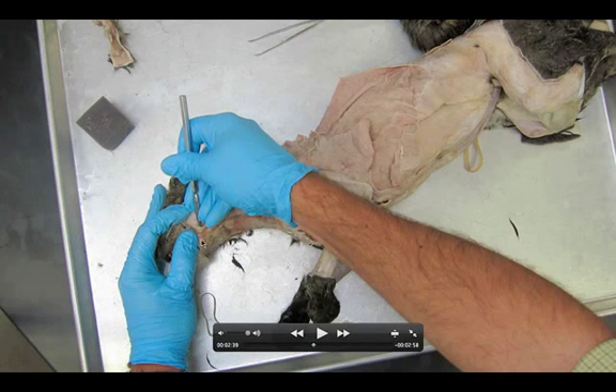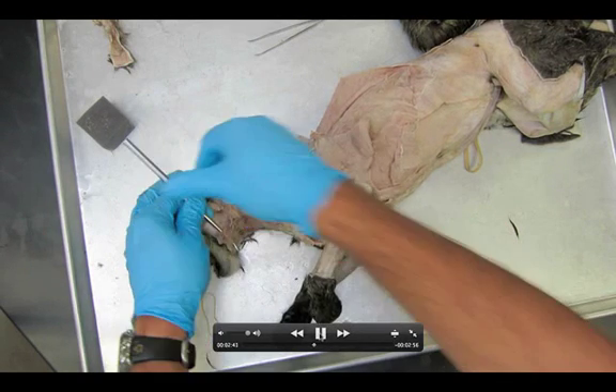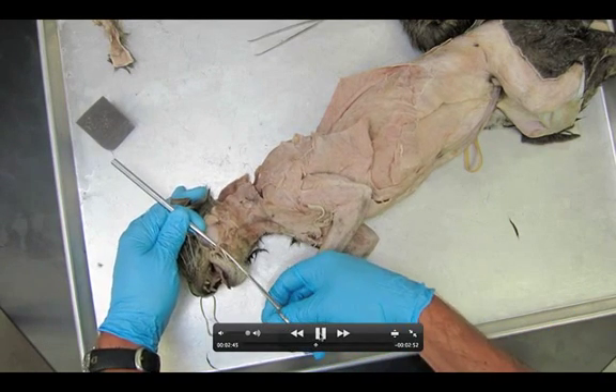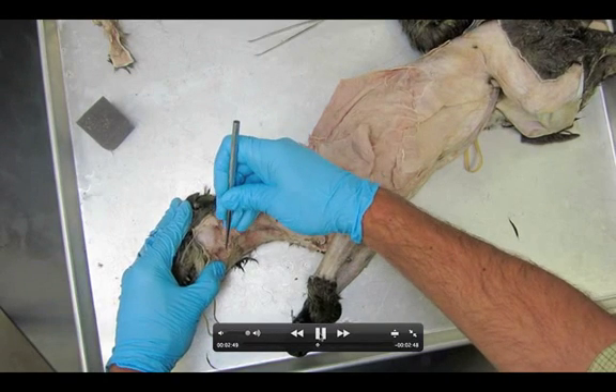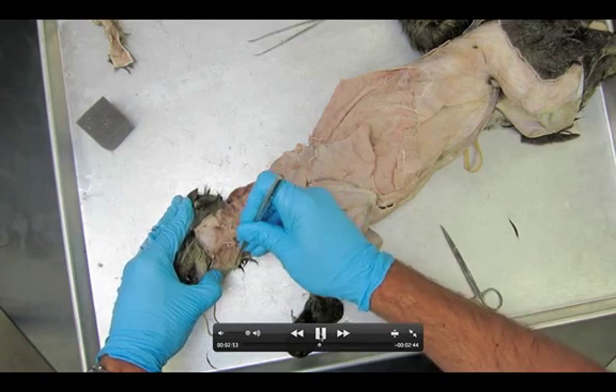All this stuff — you're going to go underneath the jugular vein and cut right through it. We don't really need it; this is not a study of the veins. Your book picture in your study packet shows all this stuff beautifully dissected out, but we're not going to worry about that. We're going to remove this tissue down and hopefully expose what we're looking for — the digastric muscles.